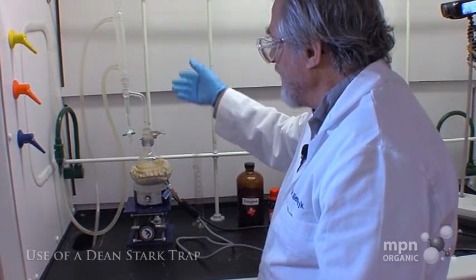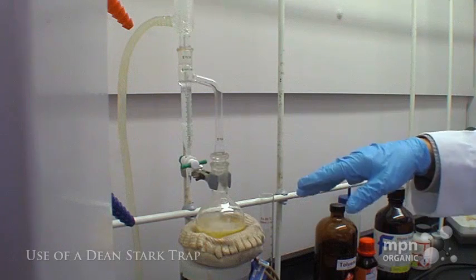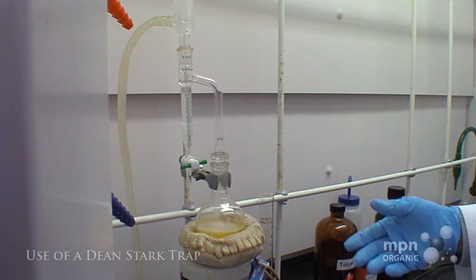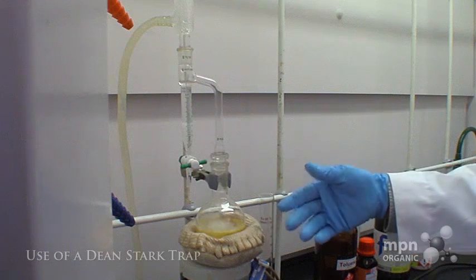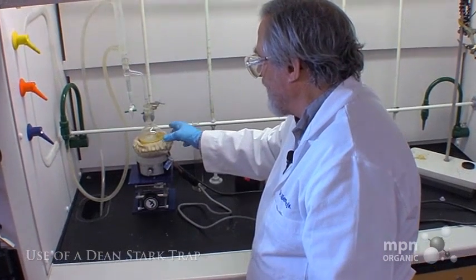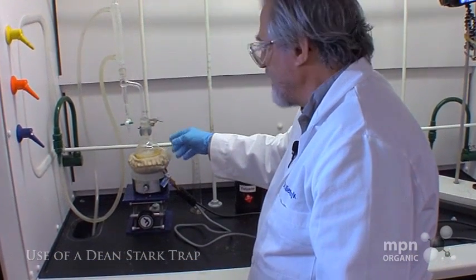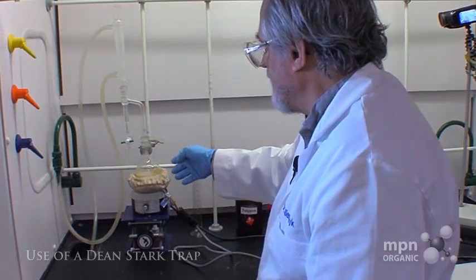So all we have to do is allow this to cool down by turning it off and then eventually working up the reaction by getting rid of the toluene and any excess p-toluenesulfonic acid and also the water-soluble ethylene glycol. Thank you.